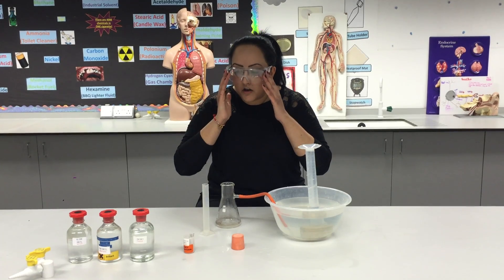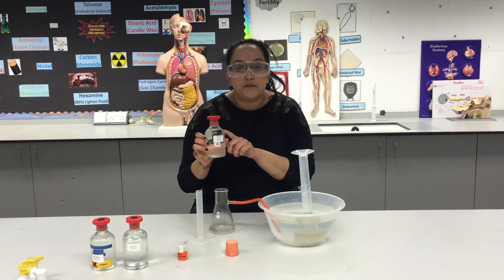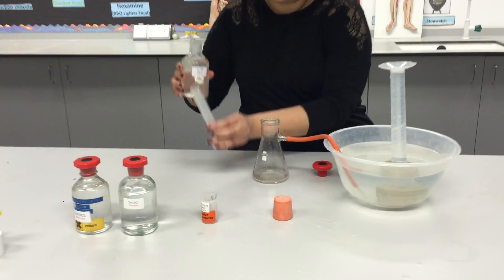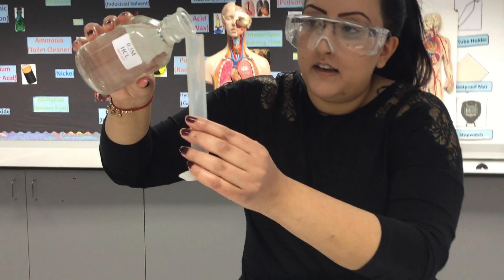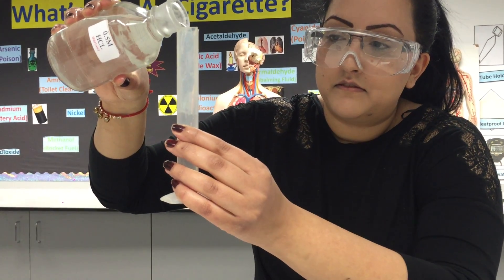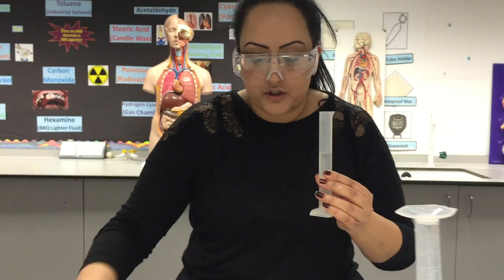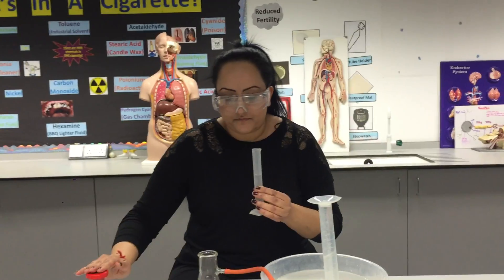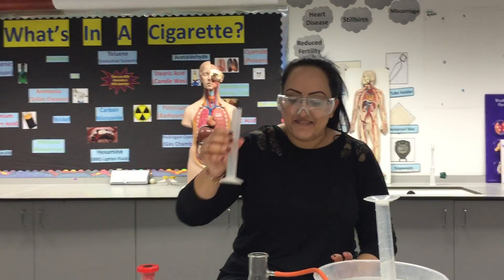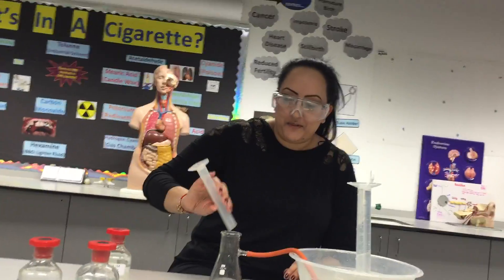We're going to start off by measuring 20 ml of 0.5 molar acid in a measuring cylinder. Get your measuring cylinder, bring it to eye level, and measure 20 ml of acid. Make sure you put the lid back on, then pour the acid inside the conical flask.